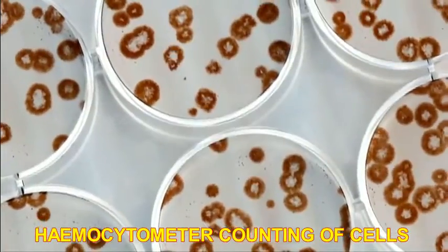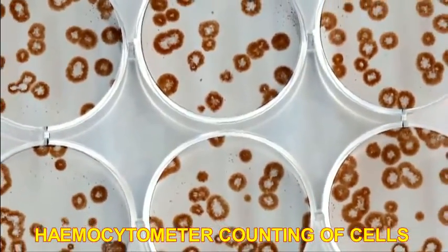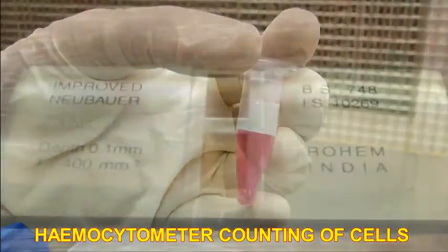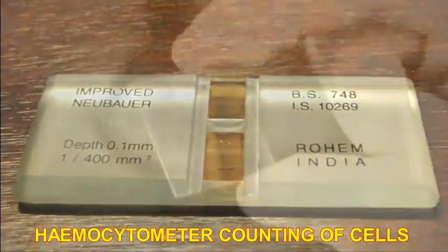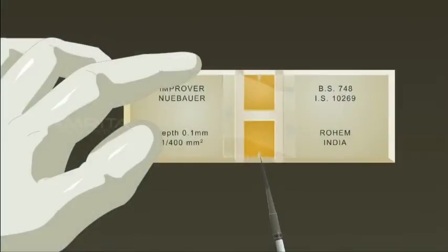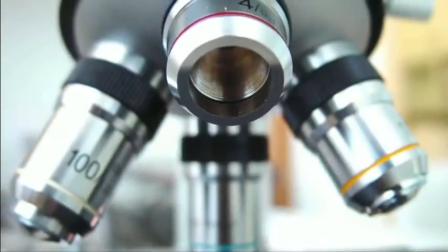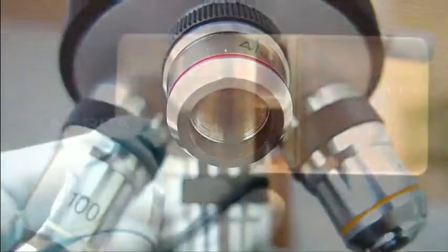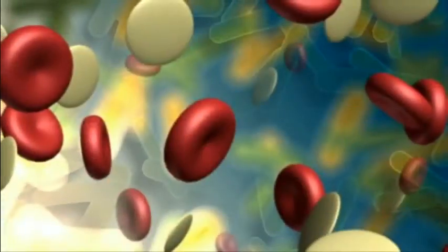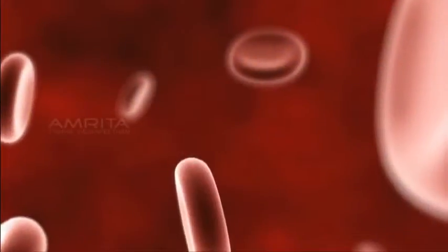The object of the experiment is to determine the concentration of cells in a given sample. A liquid sample containing immobilized cells, when placed on the chamber and covered with a cover glass, capillary action completely fills the chamber with the sample. Looking at the chamber through a microscope, the number of cells can be determined by counting. Different kinds of cells can be counted separately as long as they are visually distinguishable.